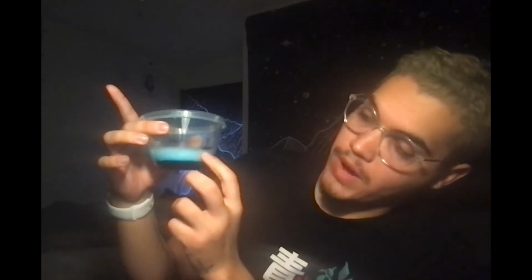And for B, where did it start? It started off here. And then it went down to this one. And then it ended up right here. And then for C, it started up here. And then it went to here, and it basically stayed at the same spot. And for D, it started here, and then it went to here, and then it ended up here.